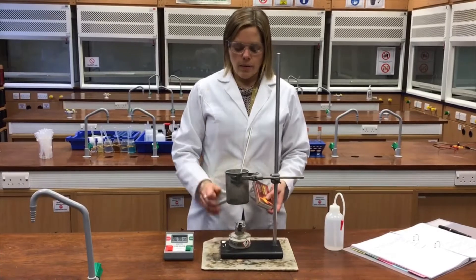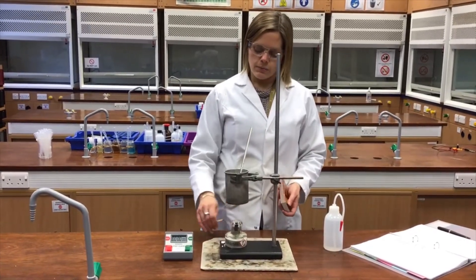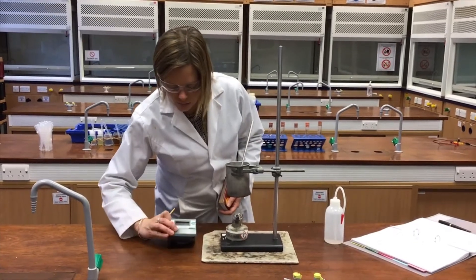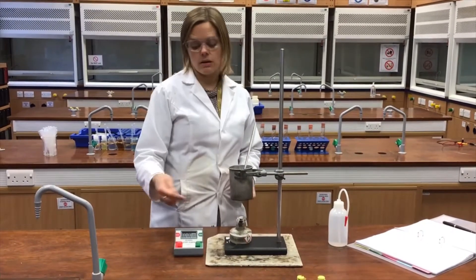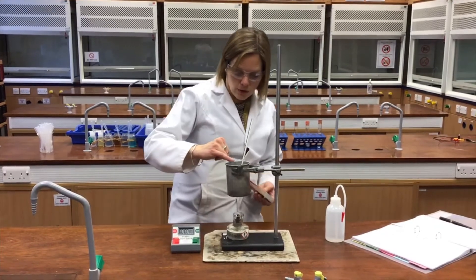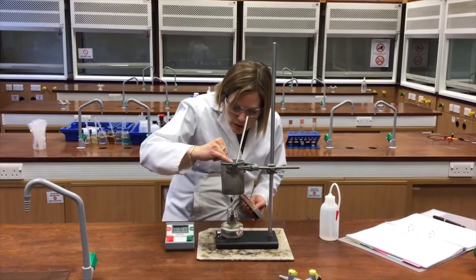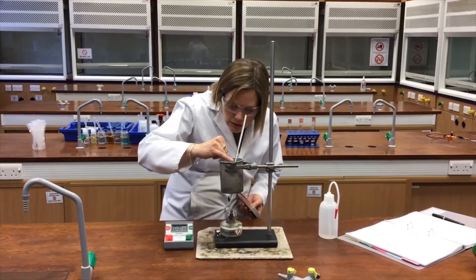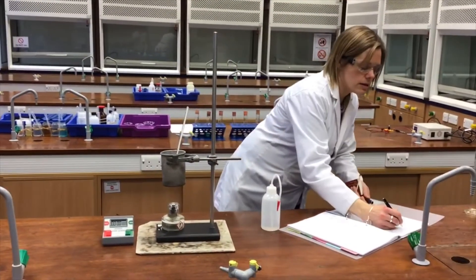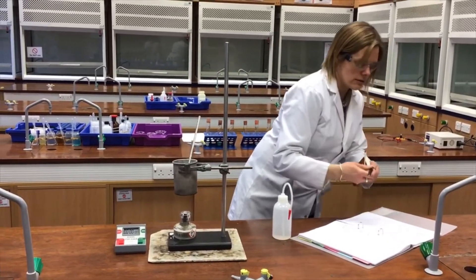In a moment I'm going to take the lid off, light the alcohol spirit burner, and press start on the stopwatch. I'll heat for two minutes. Before I do that, I need to record the start temperature, which on this thermometer is 17.5 degrees C.